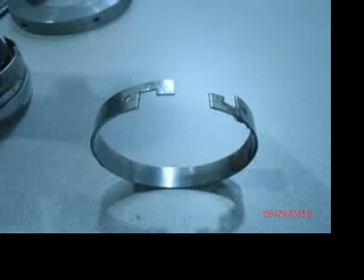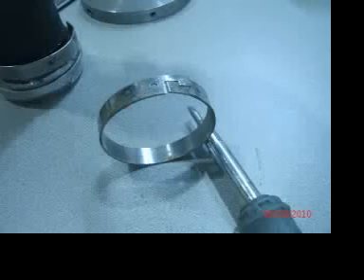Okay, now we're going to have some real fun. This is a bladder retaining ring. It is something that I've become all too familiar with. Unfortunately, there's really not a better way of doing it, and the nice thing is that at least it doesn't come apart over time. Once it's installed, it's together. Then some other systems use string or wire to tie the bladders on. So other than having to actually deal with the rings, once they're on, they work real well.